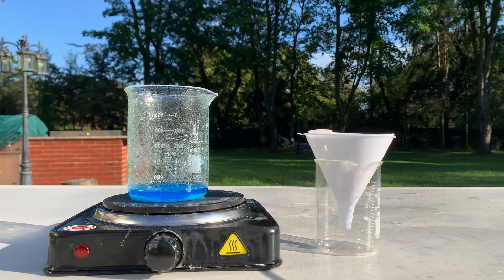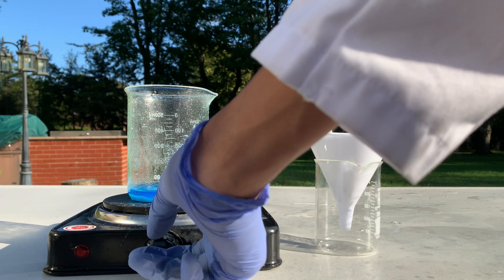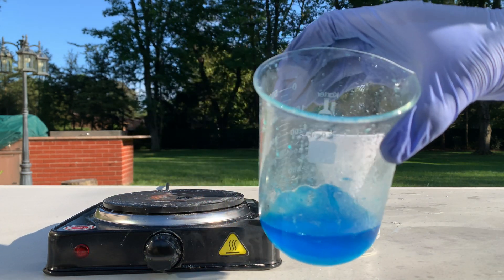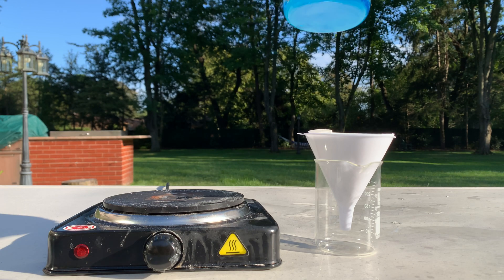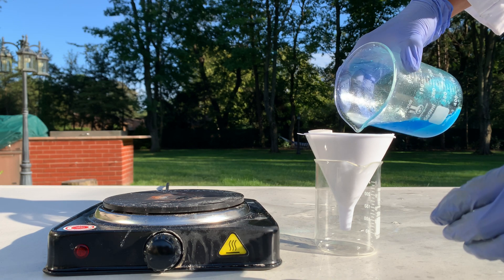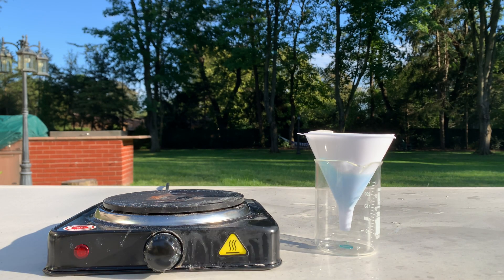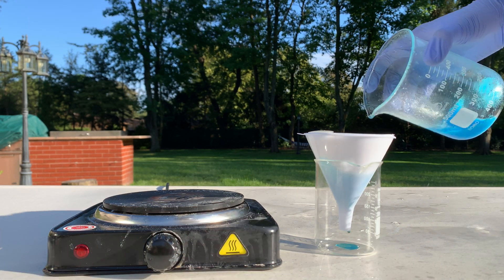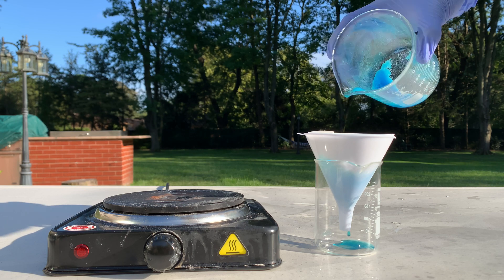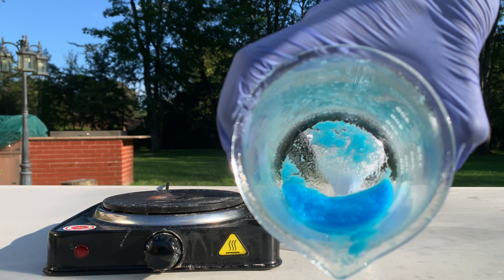Actually, I don't even think I need to boil off any of the hydrogen peroxide, because the solution heated up so much with the sulfuric acid that all the hydrogen peroxide just boiled off by itself. So we have enough copper sulfate solid at the bottom that we can just run it through the filter paper right now. Look at all that copper sulfate at the bottom — it's beautiful.